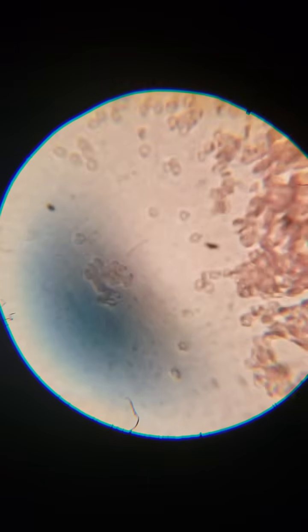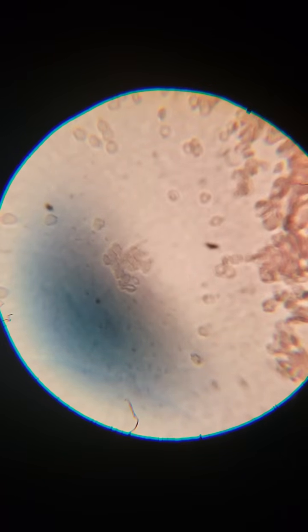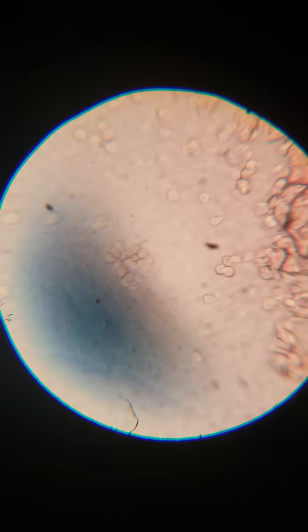Here's some lone cells for you. So there's some white blood cells right there. And those are single human cells right there. So check that out. That's what's coursing through your body, my body. There's red and there's white. White look clear on here.